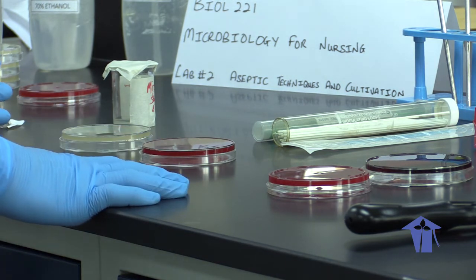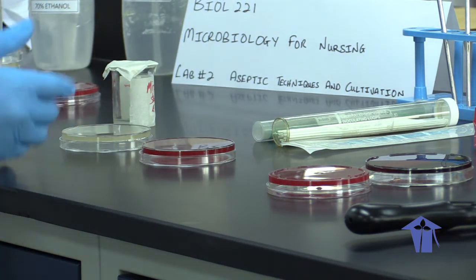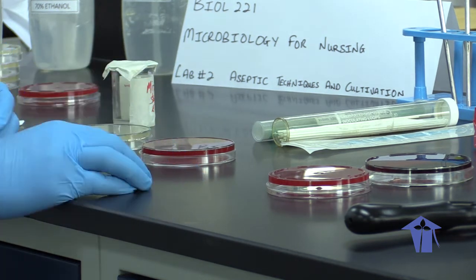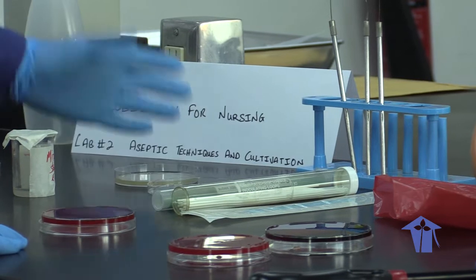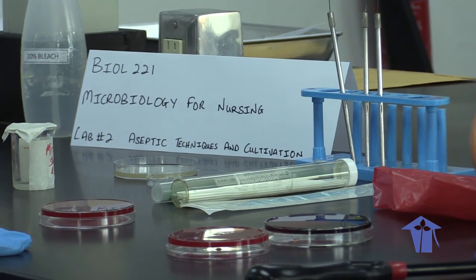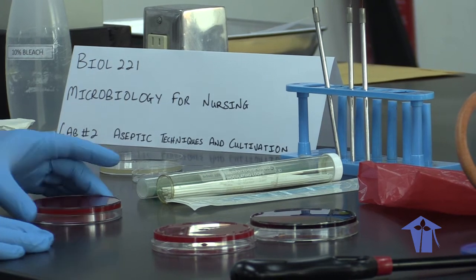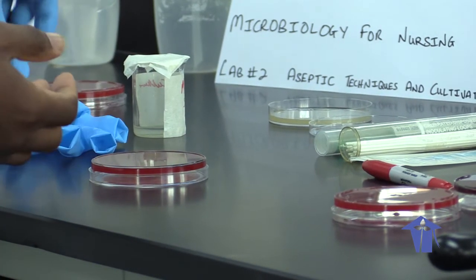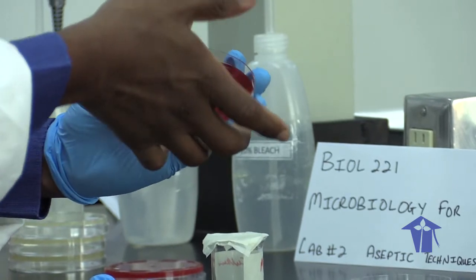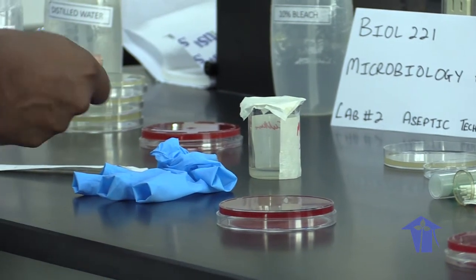I'm going to demonstrate some of the techniques we use to get cultures from different types of surfaces, isolating particular organisms found in different environments. The first one: using a nutrient agar plate, I'm going to open it up to the air. As we said, microbes are ubiquitous — they're everywhere — so we're going to see what type of bacteria we can grow from the air. On another plate, I'm going to draw a line down the middle and put an ungloved thumbprint on one half, just lightly touching it, to see what type of microbes I have on my thumb.